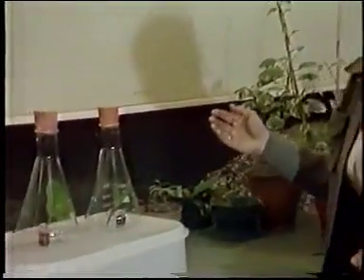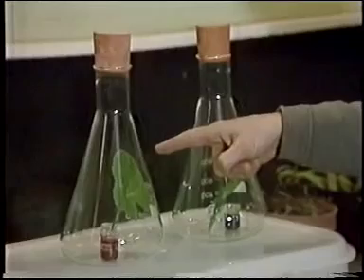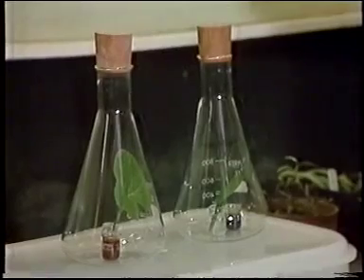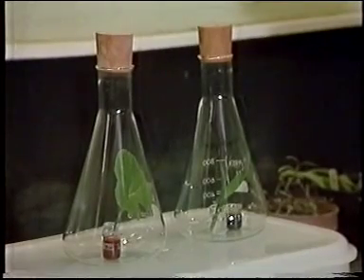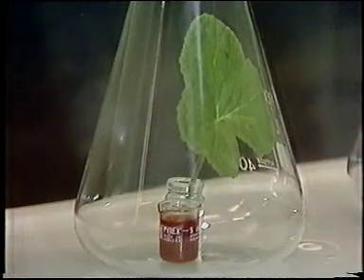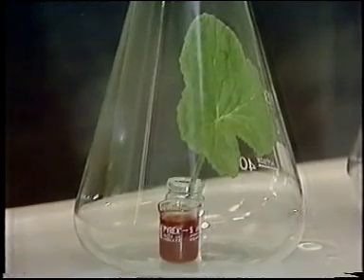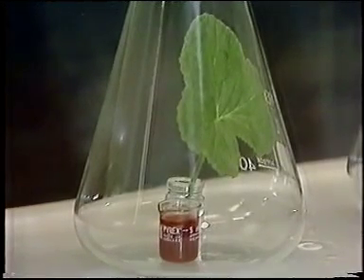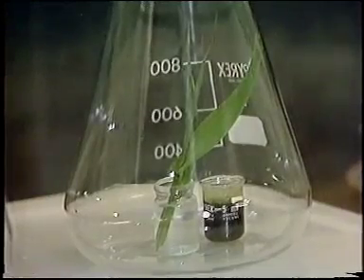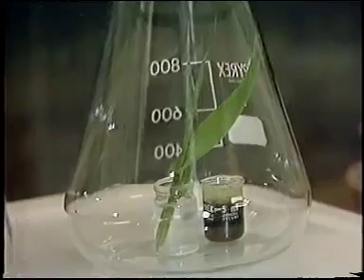In these two flasks a few hours ago, I enclosed a leaf of a C4 species and a C3 species. And inside we put a little bit of universal indicator in these small flasks. Now that indicator will absorb CO2 from the air, and when it does so it goes red. And what you see is that the C3 species has indeed got a red indicator. So this species, when it reached its compensation point, had quite a lot of CO2 left in the flask, whereas the C4 species had virtually none. It had removed nearly all the CO2 from the inside of that flask, and the indicator didn't change colour.